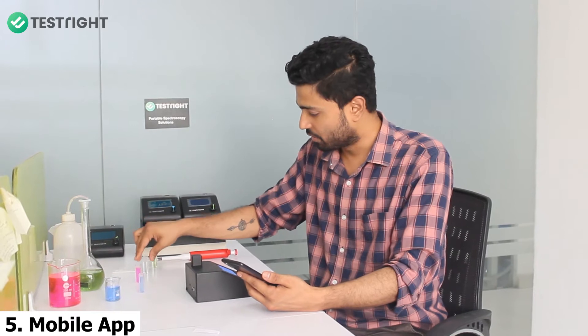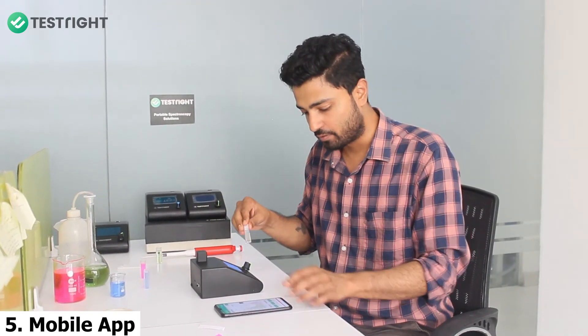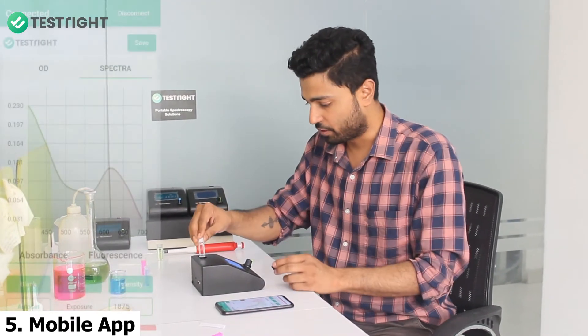Now let's move to the app. All the functions that you just saw can be accessed on the smartphone app as well. Let me start by demonstrating the absorbance mode.